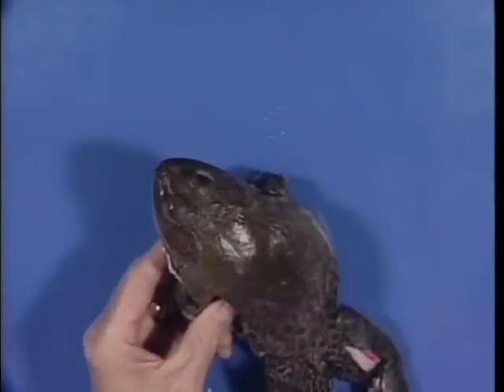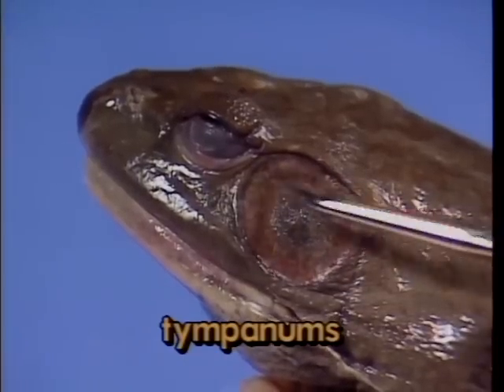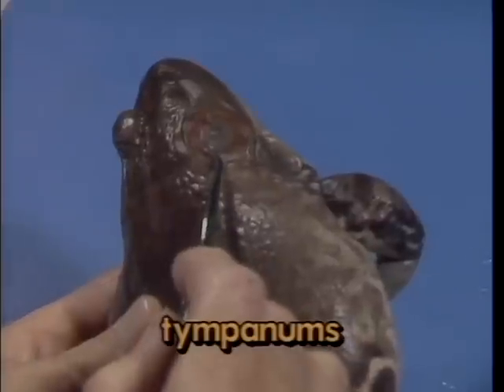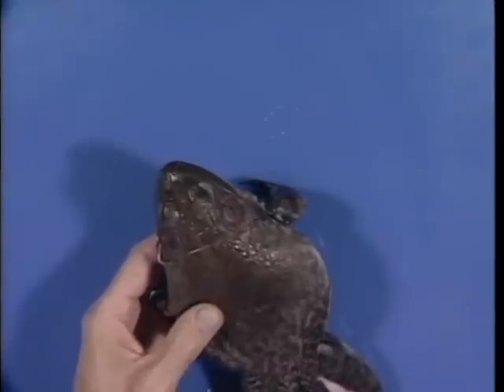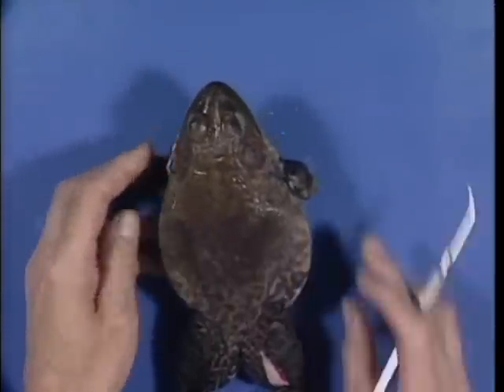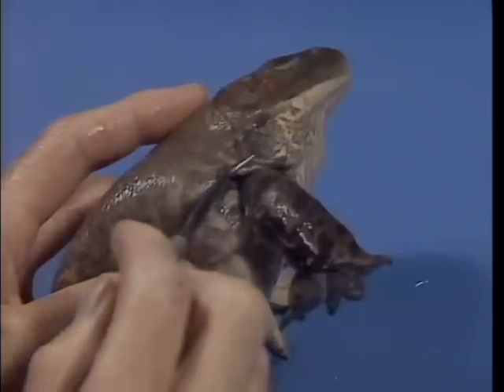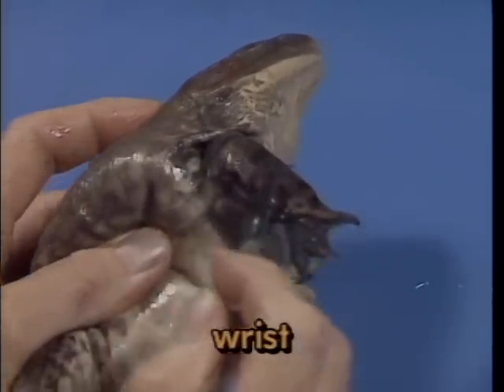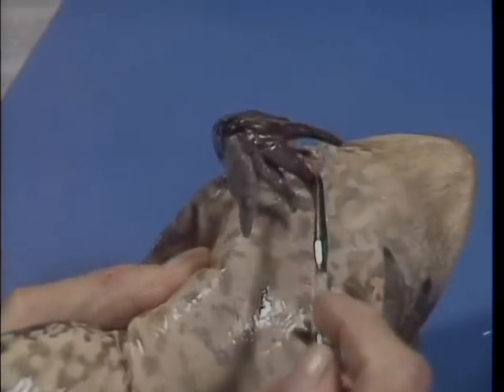Further posterior on the head are located paired tympanums. These membranes function as eardrums, just as they do in other vertebrates which have the ability to hear. Now let's turn our attention to the trunk anatomy. Frogs have 4 well-developed appendages. The front limbs are rather short. They consist of an upper arm, a forearm, a wrist, and a hand. Each hand has 4 fingers rather than 5.